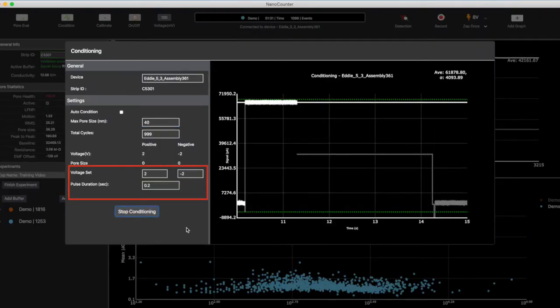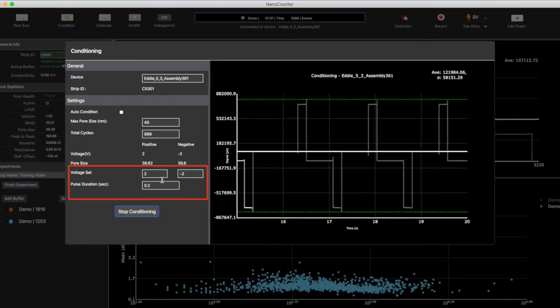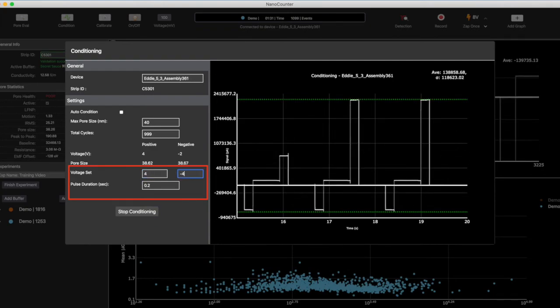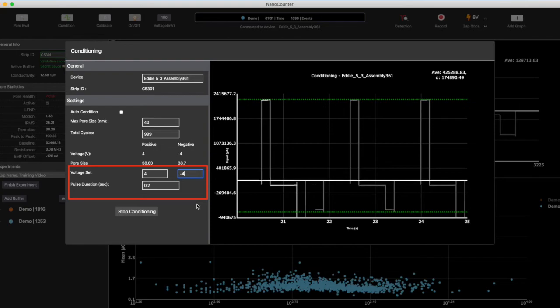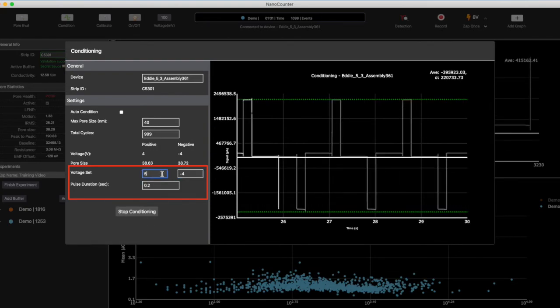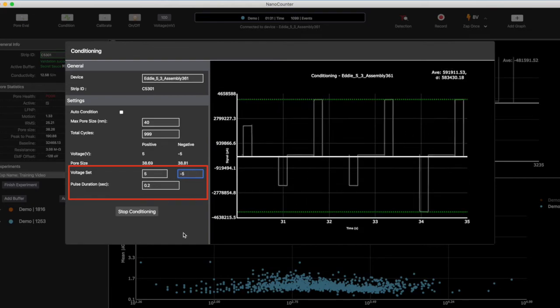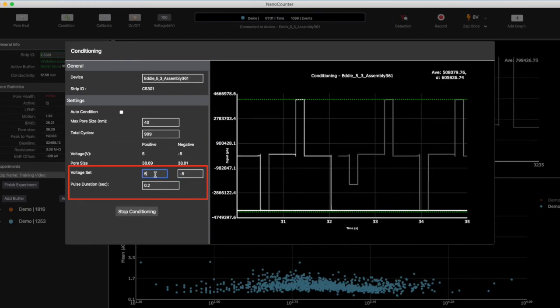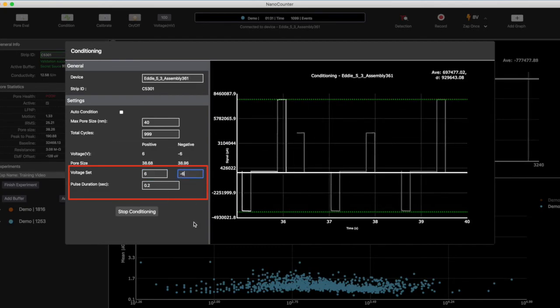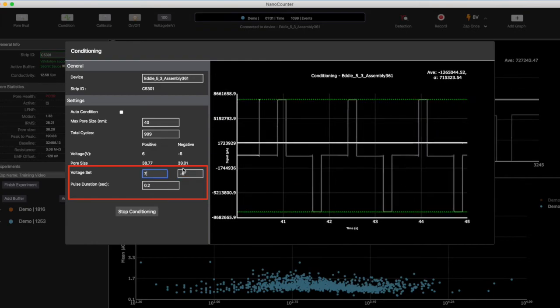2 volts is not enough to unclog the pore. Observe the peaks. When you are ready, step up to 3 volts, then 4 volts on each side. 3 and 4 volts are also typically not strong enough to unclog the pore. Step up to 5 volts. Most clogs will not respond at 5 volts, but some might. Look for an upward slanted peak to see if the conductance is increasing. If so, stop increasing voltage and let it reach the stop size. If it is still not gaining conductance, increase to 6 volts on each side. If necessary, go up to 7 volts on each side.